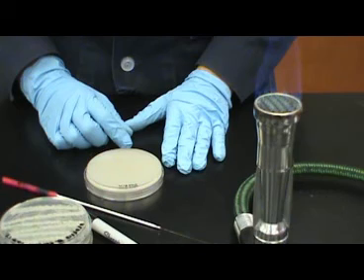This enzyme will diffuse through the agar and break down any casein or milk protein that it comes into contact with. This forms the halo that you see surrounding the colony of bacteria. The observance of a halo around the colony of bacteria on a milk plate is positive for casein hydrolysis and the production of the enzyme known as casease. Casein agar, or the milk plate, is an easy and simple way to determine hydrolytic activity and the production of casease in bacteria. It is often used for identification of gram-negative or gram-positive organisms.